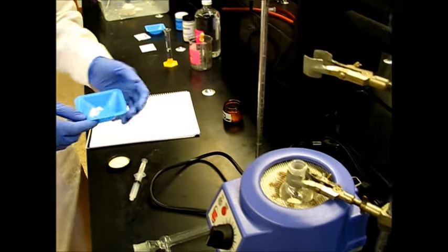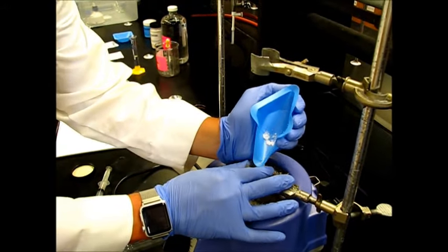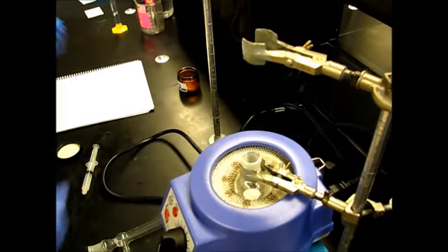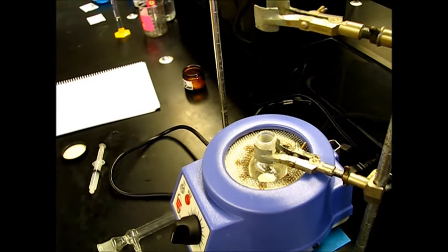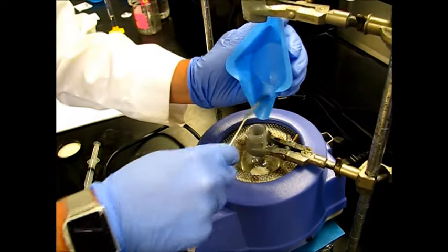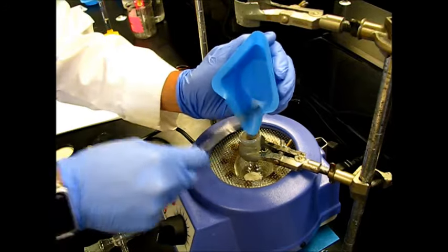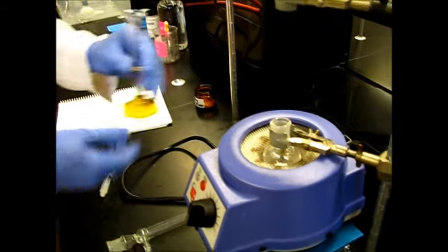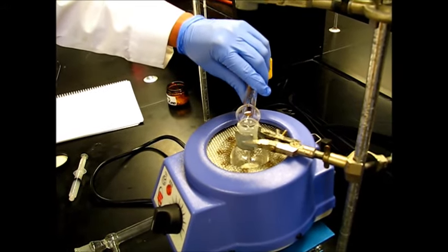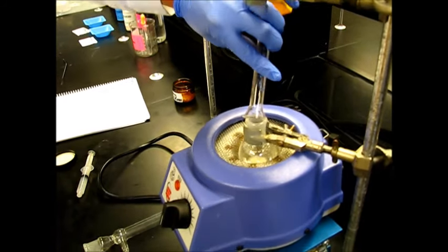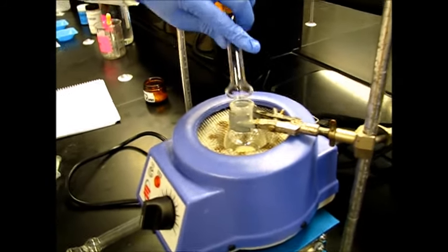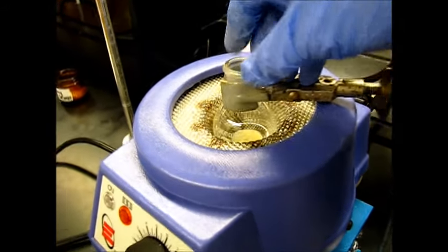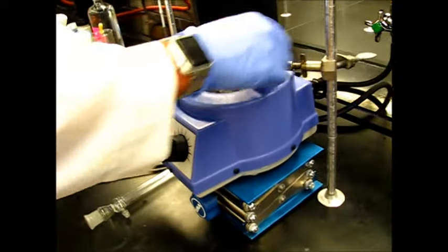Now we're going to add our 0.25 grams of maleic anhydride. And finally we're going to add six milliliters of the xylene. And this round bottom flask is a 50 ml or 25 ml? 50 ml. This is a 50 ml round bottom flask. So we're going to go ahead and tighten this up just a little bit.